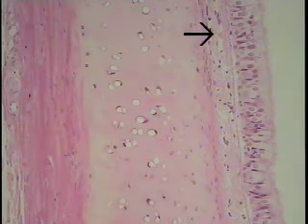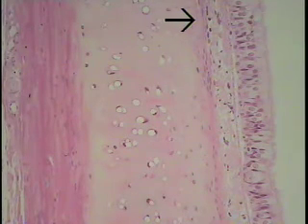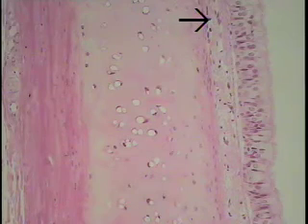One can see on this particular surface the pseudostratified columnar epithelium that is ciliated, examined previously. The tissue we're examining today is cartilage, extending from about where the tip of the arrow is now to approximately this area here, the remainder being of a denser type of connective tissue. This is a specimen as seen at low power of hyaline cartilage. Even at this magnification, a thin connective tissue capsule surrounding this cartilaginous piece is visible, known as the perichondrium.